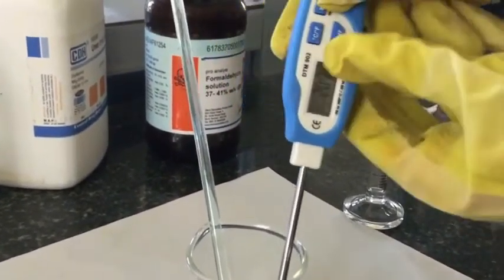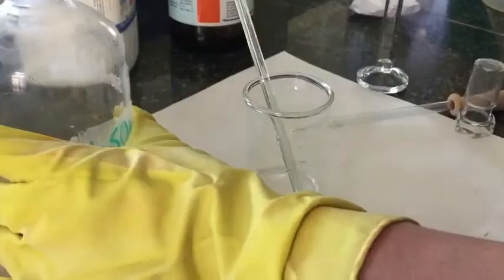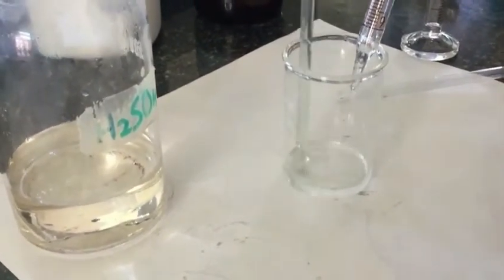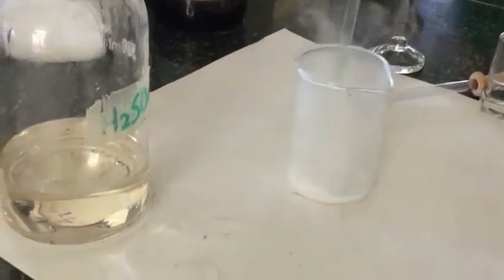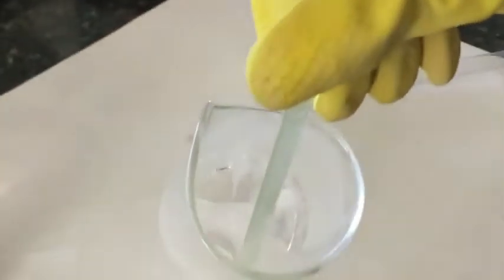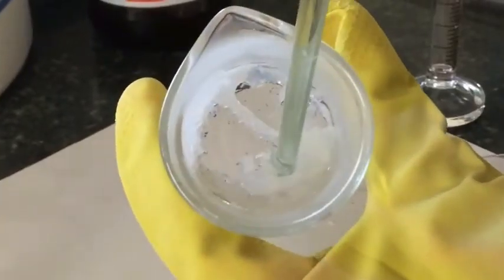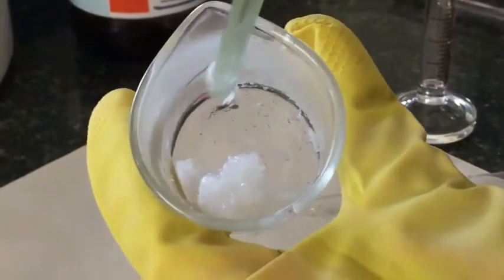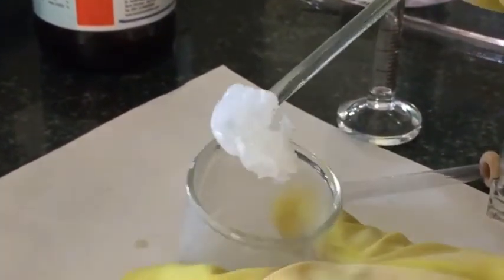The temperature while dissolving urea in formaldehyde — it is an endothermic reaction. Now we are adding H2SO4 to this urea formaldehyde solution, which initiates the reaction, and here you can see the slurry formation of the polymer takes place. You can see how it looks. We will remove it and wash it with water. Here you can see the fumes of H2SO4.